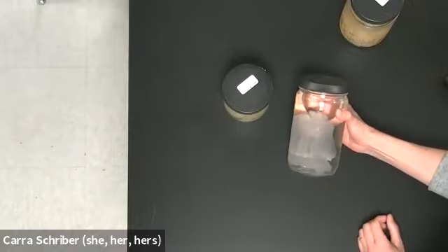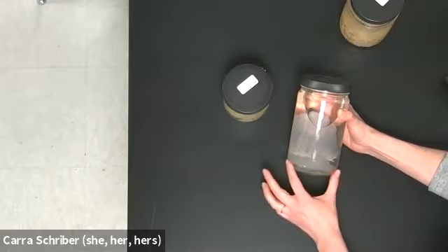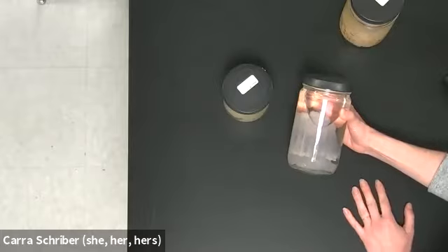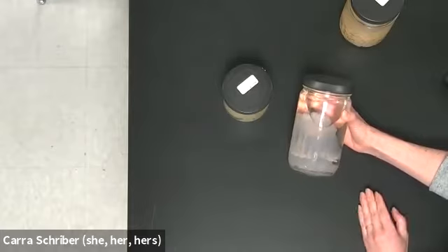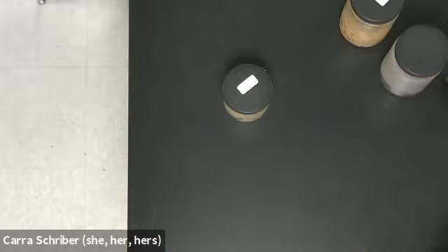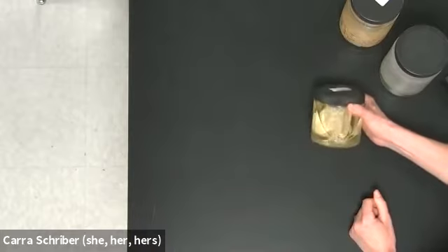This one here is a moon jelly, and you can see kind of the cap on the top, and it has very short tentacles. It's actually just like this last little inch here. So that's a little bit different morphologically, but same basic. And I want you to think, while we're looking at these examples of cnidarians, are we looking at the polyp form or the medusa form? So I'm going to show you one more, and then I'll tell you.